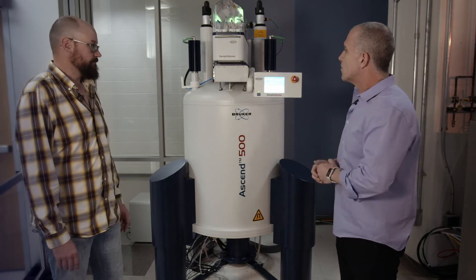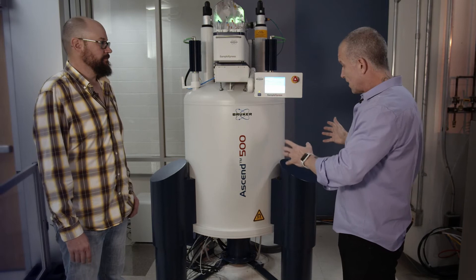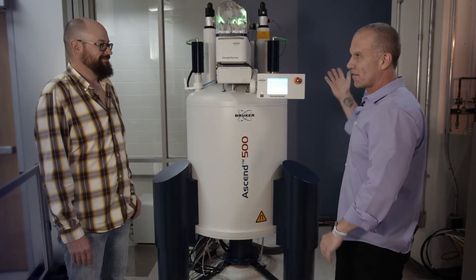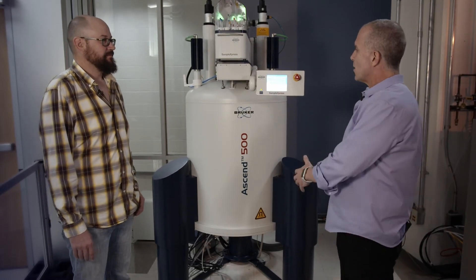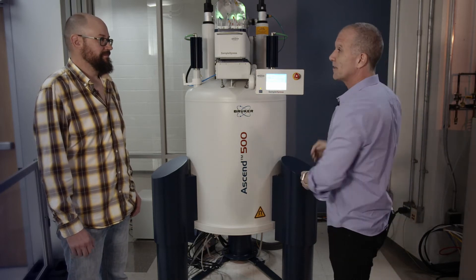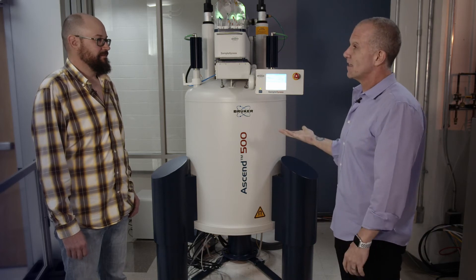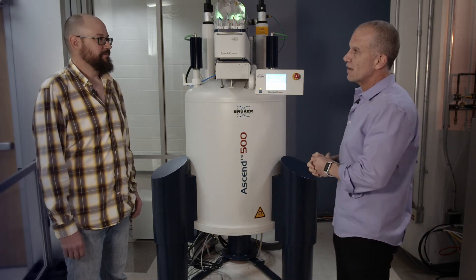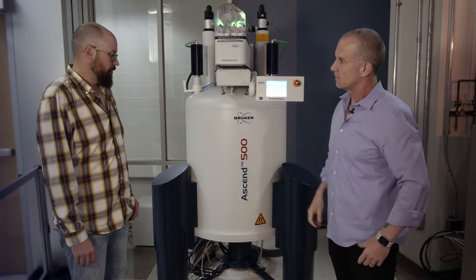NMR spectroscopists and NMR managers deal with the bottom part of the magnet more than the top. While you put your sample in from the top, it really matters what the sample goes into. It goes into the superconducting magnet, but there are quite a few components from the bottom that play a crucial role in NMR. Could you tell us what is mainly involved from the bottom part of the magnet?